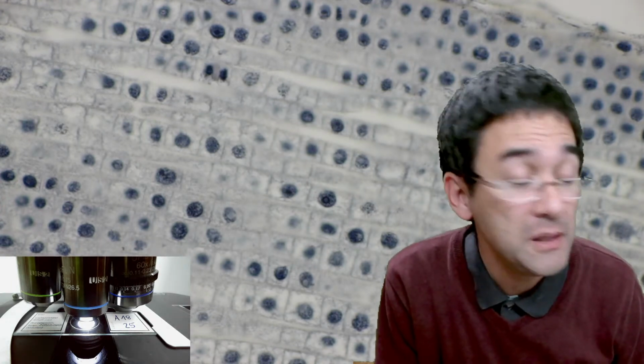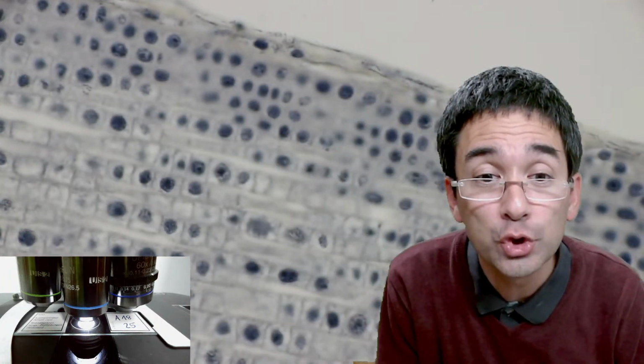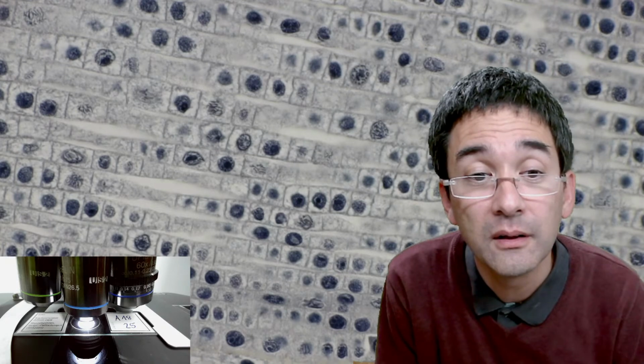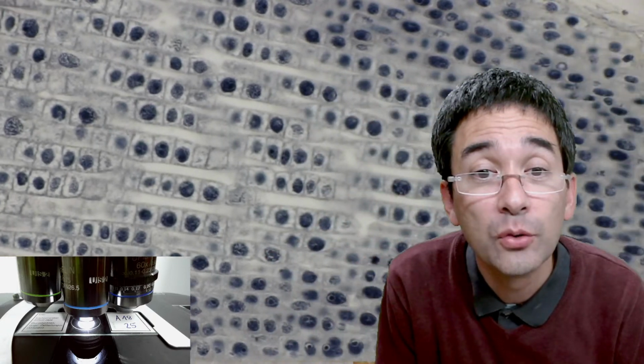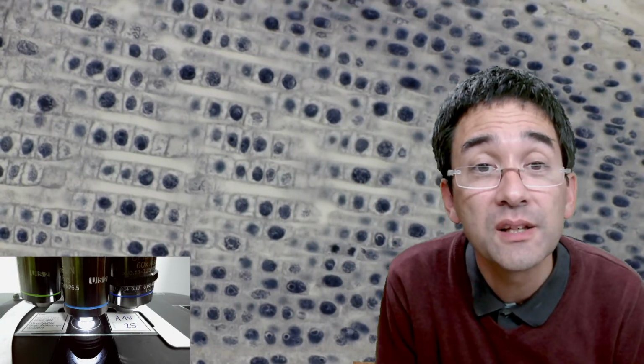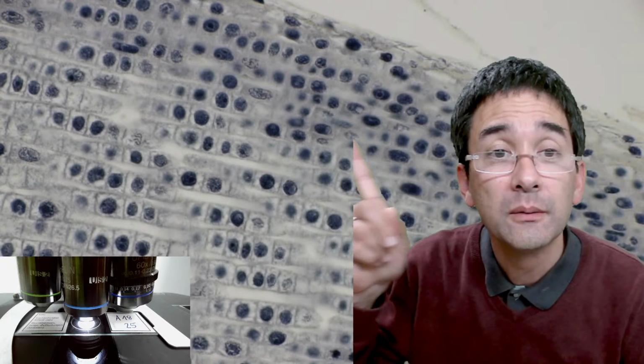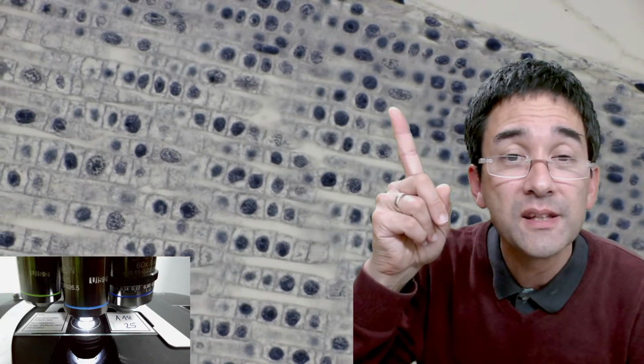That's correct, because mitosis is only a short part of the cell cycle. Maybe just to get an overview here a little bit. I have seen again a few cells in prophase. Again, a prophase cell. Where's this? Here, this is again a prophase cell. This one here. But maybe it's a little bit easier if I go up with the magnification again. I'm seeing a metaphase cell. Oh, what a coincidence. This one over here, again metaphase.